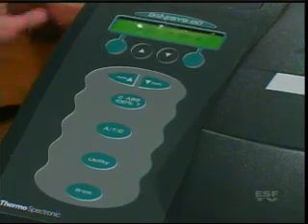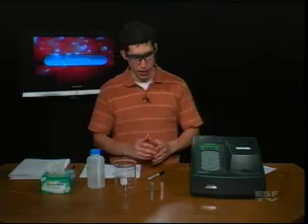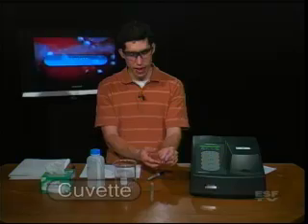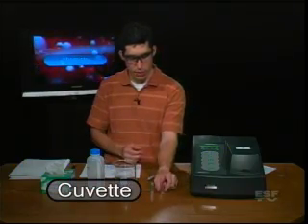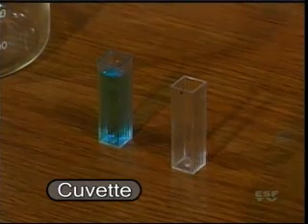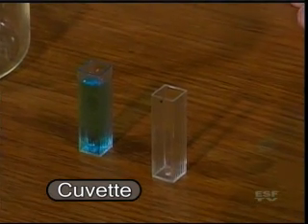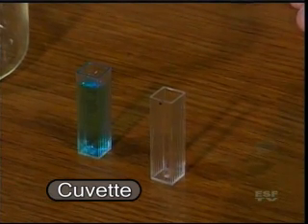So let's talk a little about what we use to put into the spectrometer and how we measure — and those are the cuvettes. A cuvette is just one of these little pieces of plastic cubes, and they can hold our solution, which we can measure. We're going to measure this blue solution in a short amount of time.